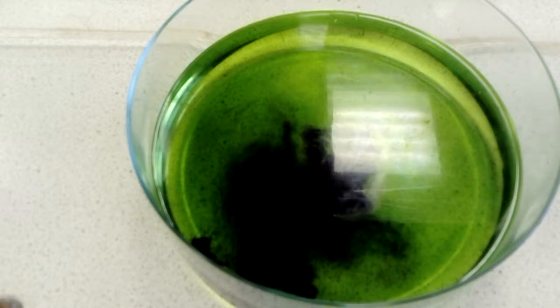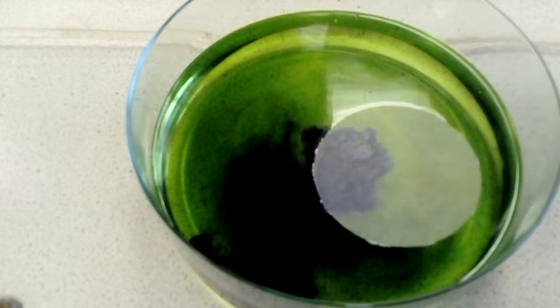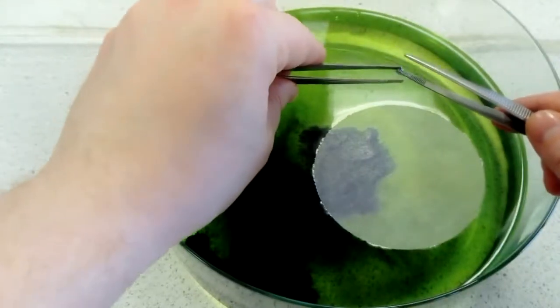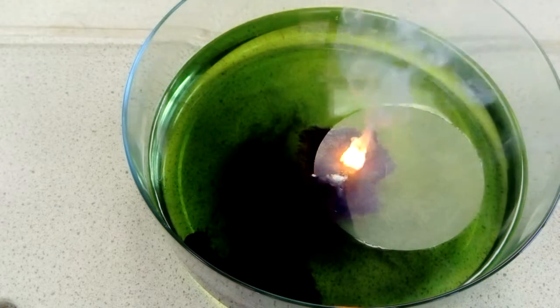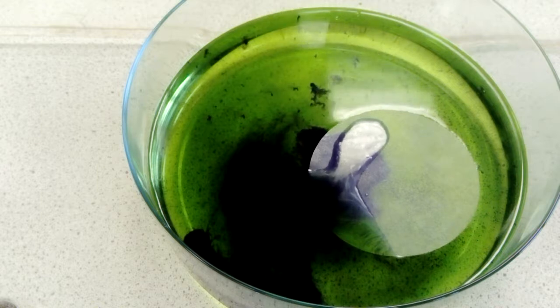A little trick that we can do with sodium. If we get a small bit of sodium and we put some filter paper in to start off with, we're decreasing the area that's in contact with the water. We should see something a bit more spectacular. Same again. This time the sodium has ignited the hydrogen that's being given off, so it's actually set on fire.